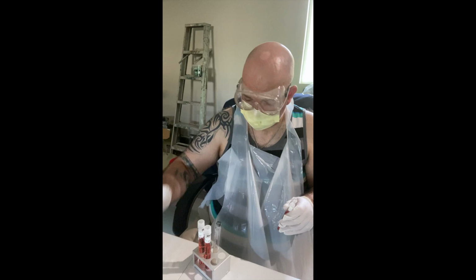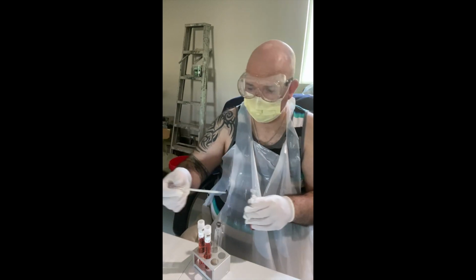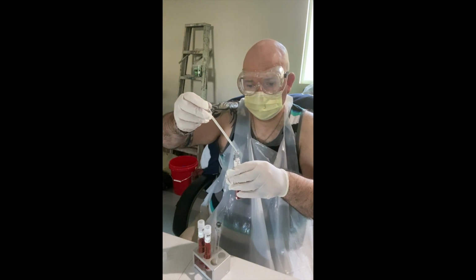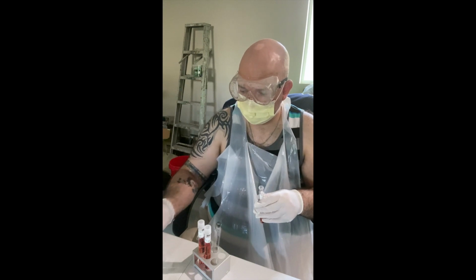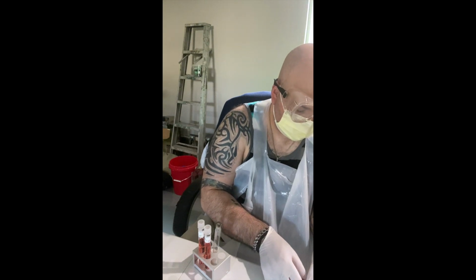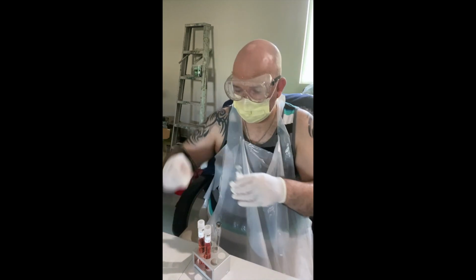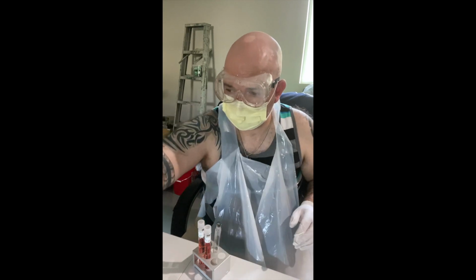Okay, I'm going to drop some of the culture with my pipettes. And again, 4 drops. 1, 2, 3, 4. Alright. Flame this again. Okay. Lid on. And set it aside.